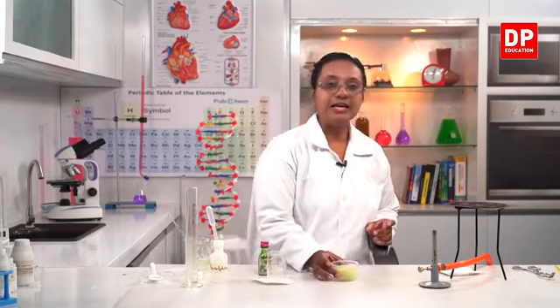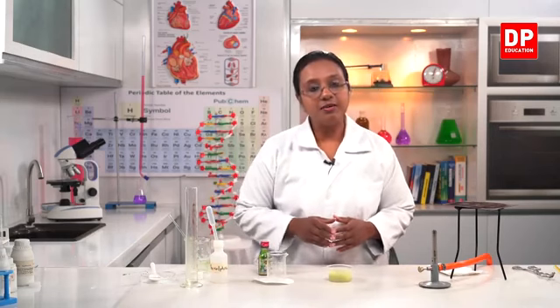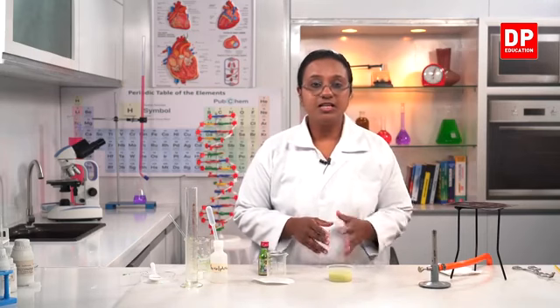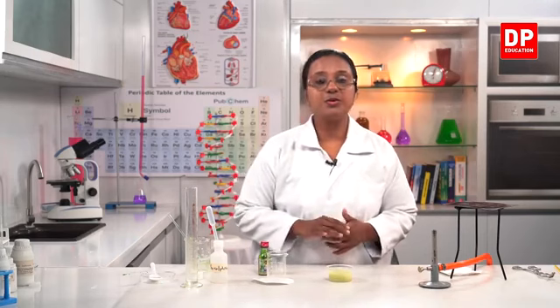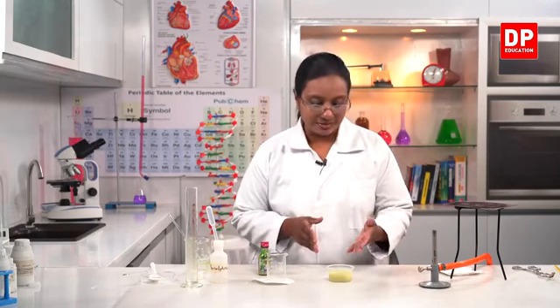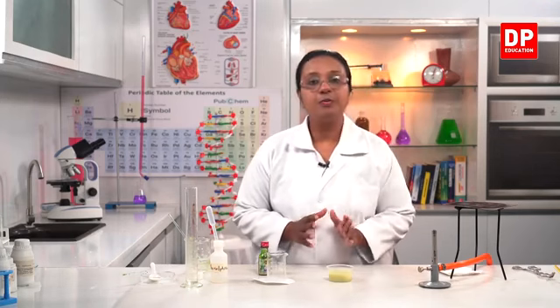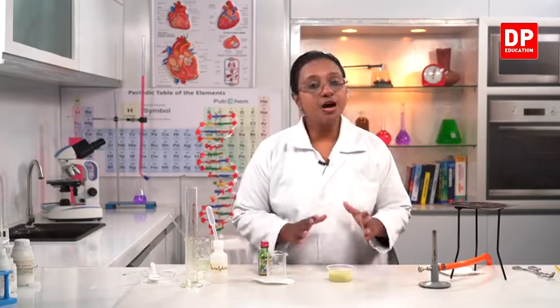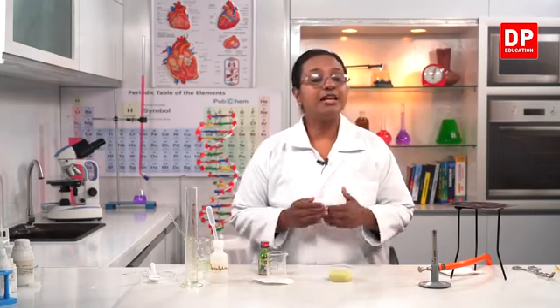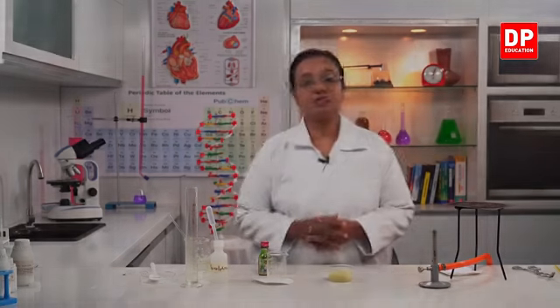So what did we add here? We took 40 milliliters of coconut oil and 40 milliliters of sodium hydroxide solution. The coconut oil was heated to 70 degrees. Then I transferred the sodium hydroxide, mixed it well for about 15 to 20 minutes. Now after 20 minutes, you can see the pasty soap mixture is there. So now we need to leave it aside for 12 hours so that it will completely solidify. So I will show it to you all after 12 hours.